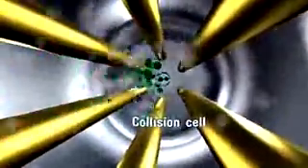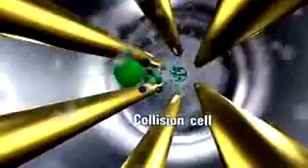In the hexapole collision cell, precursor ions strike collision gas molecules generating product ions and neutral fragments. Linear axial acceleration and high collision gas pressure ensure that all ions exit the collision cell with nearly identical energy. This allows the same mass calibration factors to be applied to MS and MS-MS ions, resulting in better than 5 ppm mass accuracy for MS-MS ions.